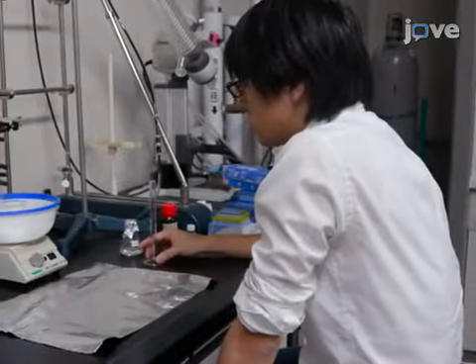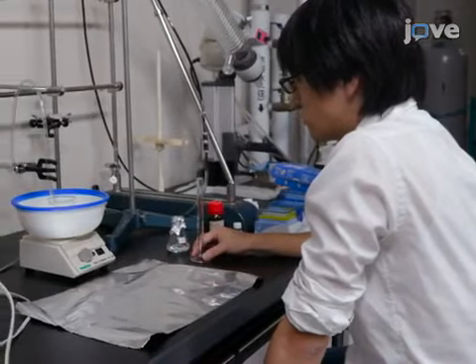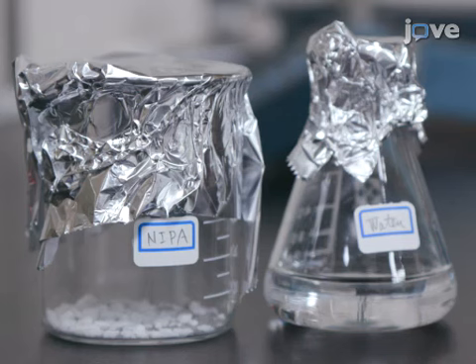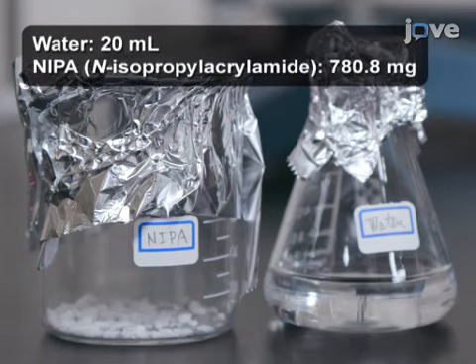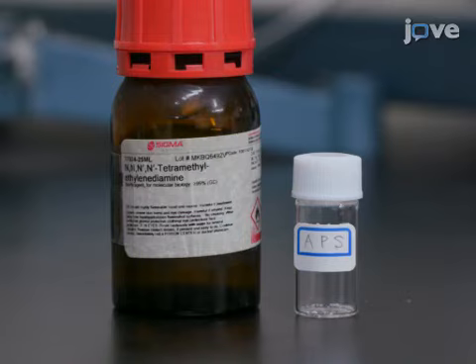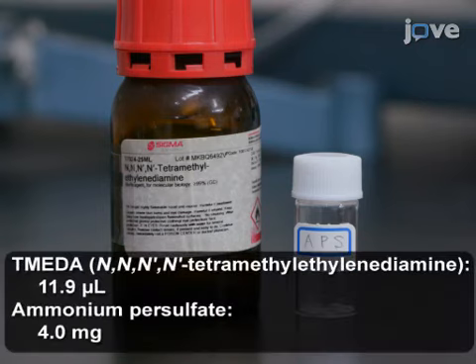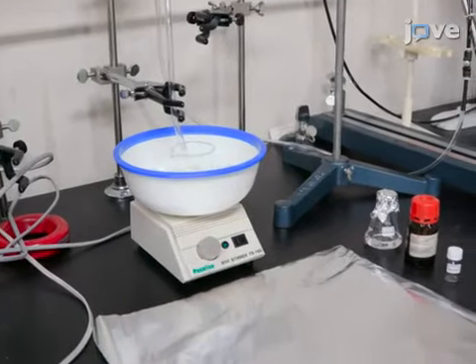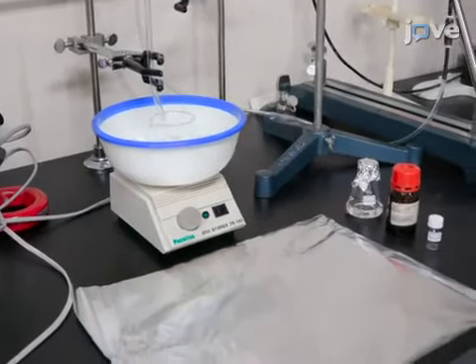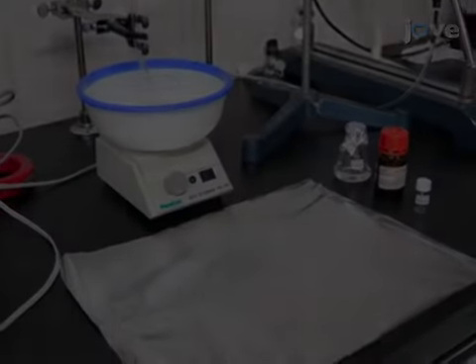The samples for the experiment must be prepared a day ahead. Sample preparation requires 20 milliliters of degassed, deionized water, as well as purified NIPA. In addition, it requires small quantities of TMEDA and ammonium persulfate. The preparation steps also make use of an ice water bath on a stirrer, 2 reaction vessels, aluminum foil, and a source of argon.